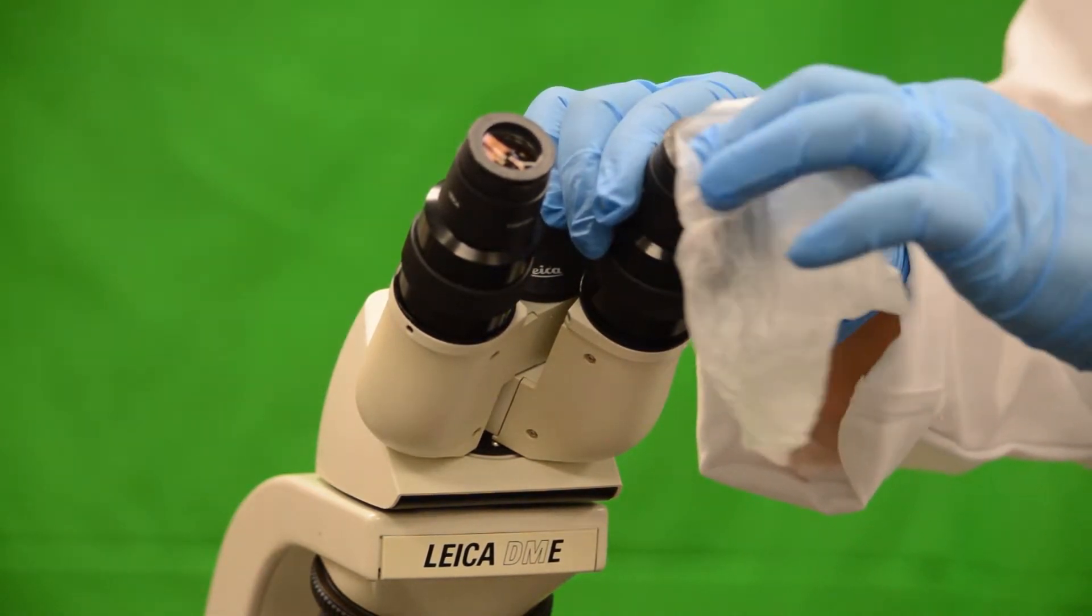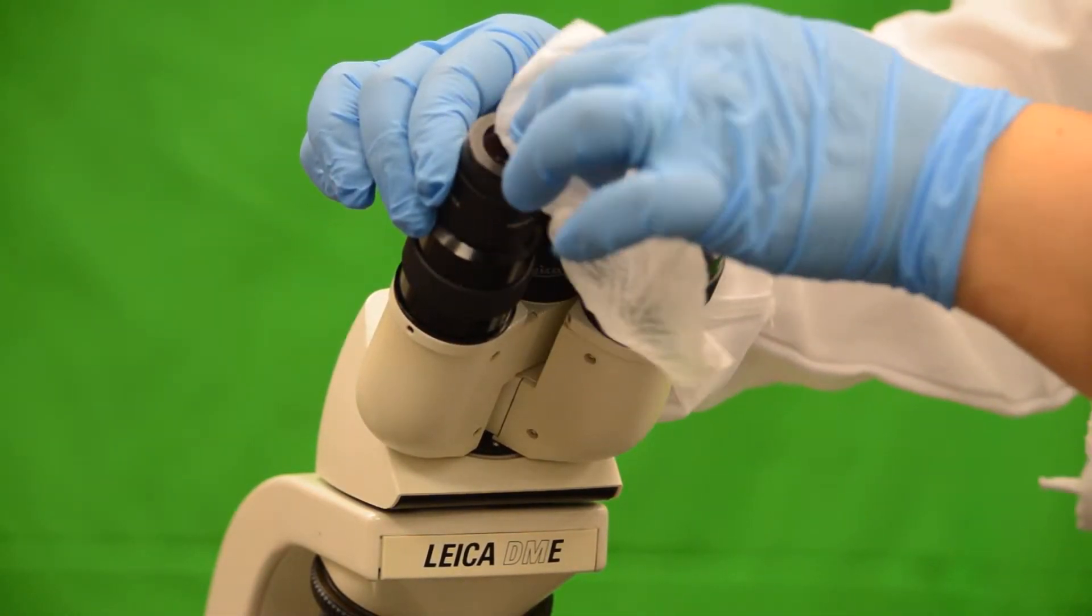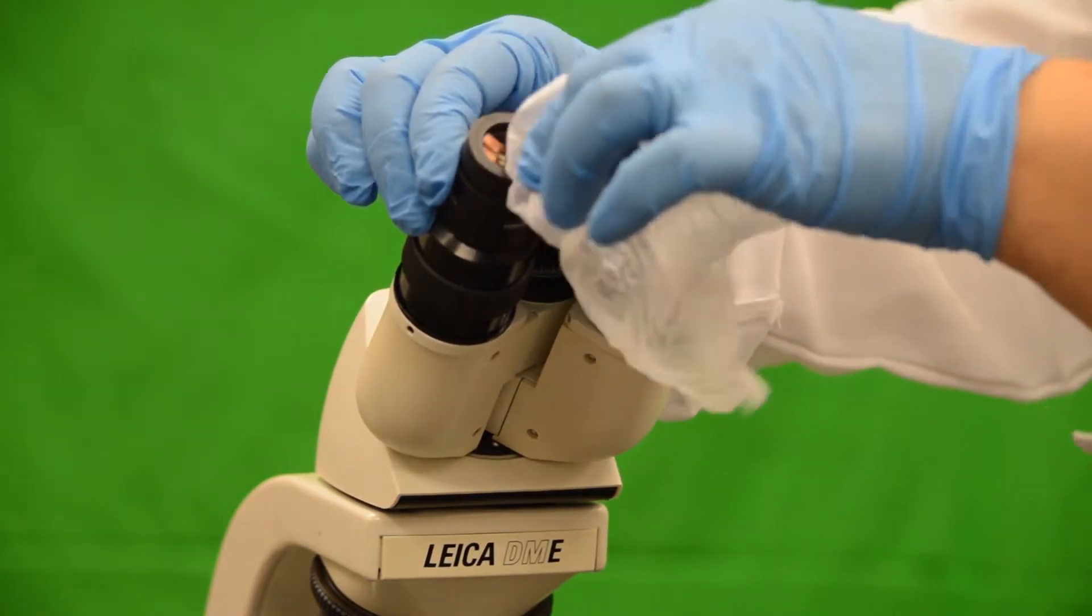The cleaning of the lenses of the objectives, the oculars, the condenser, and the light source is rather simple.